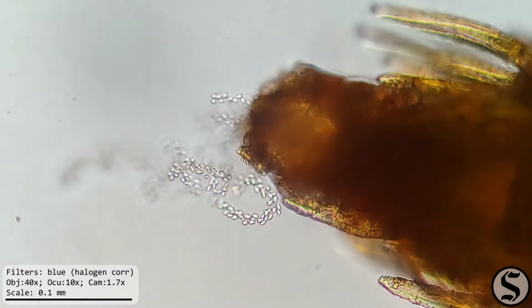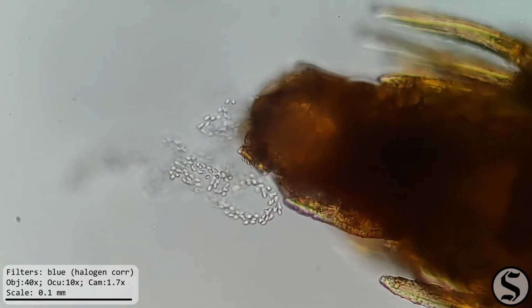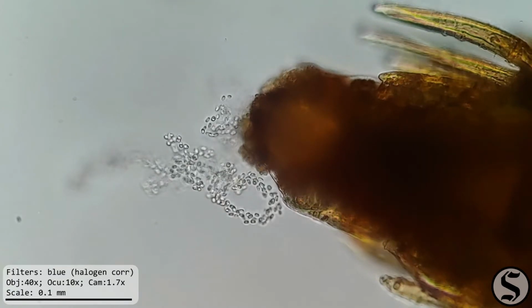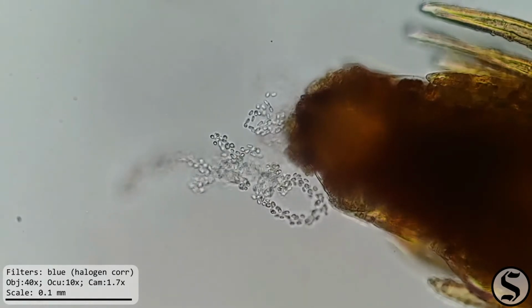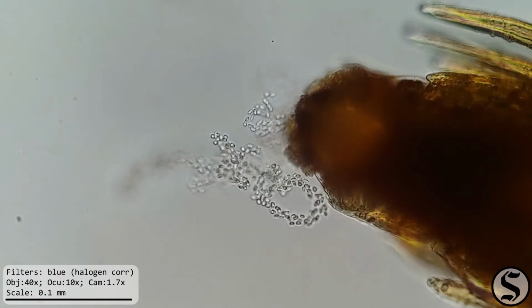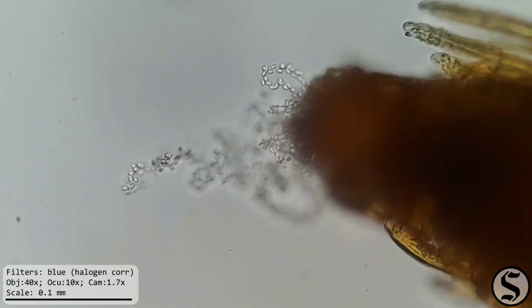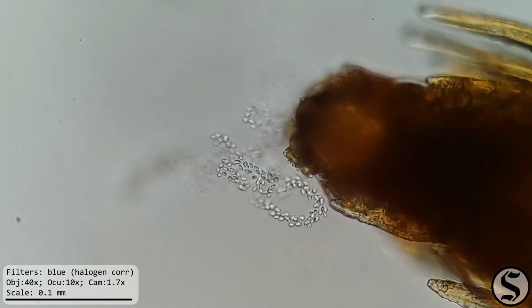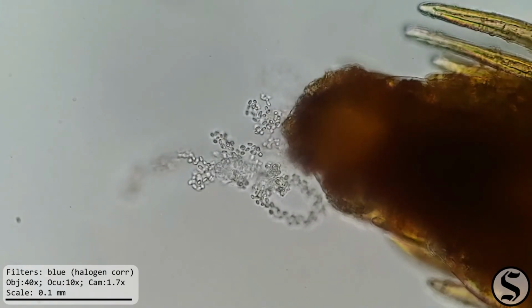I wonder if being wet caused the sporangium to start releasing spores. I mean, that would make sense if you were a moss. You'd want to release spores in wet conditions, maybe after it had just rained or something, because like I said, being non-vascular plants, mosses need to be low to the ground and have access to plenty of moisture. Or maybe it just occasionally releases some spores and I just happen to be looking at it at the right moment.